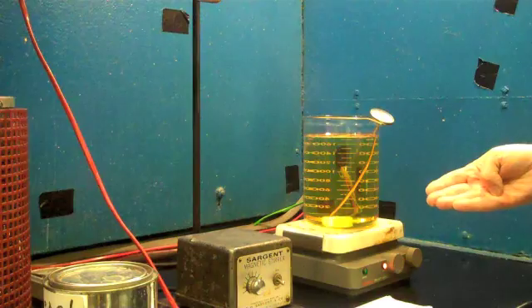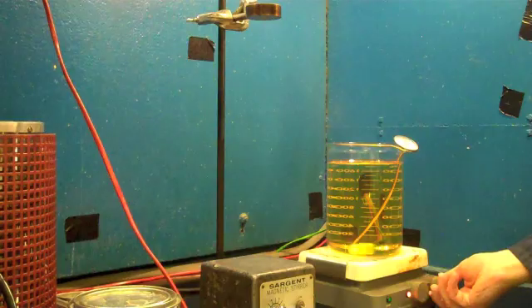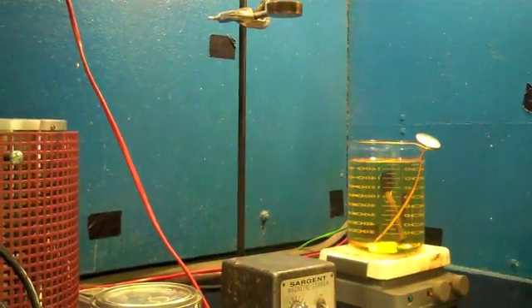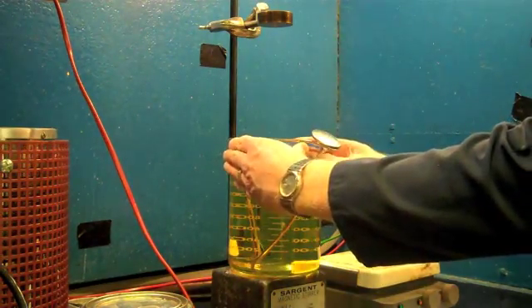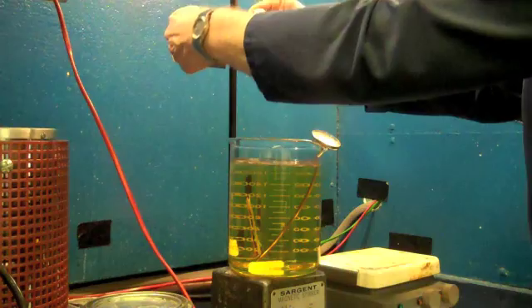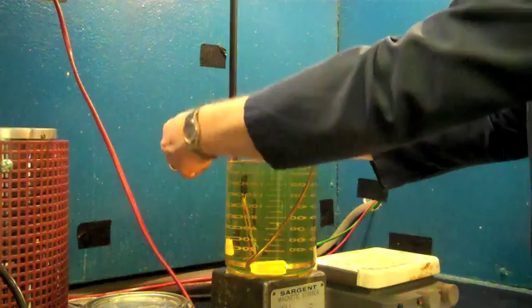Once the oil and the test probe are both at the required temperatures, we transfer the beaker of oil to a ring stand that has a support for the test probe attached to the ring.